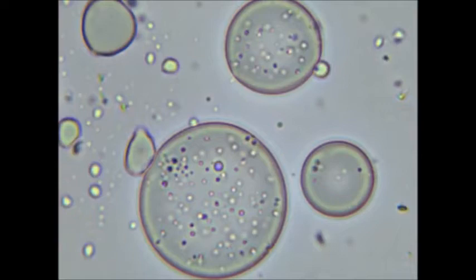I found this experiment which shows that fatty acid vesicles are less permeable to the external environment when a solution of an amino acid is added. In the original experiment, the researchers used the amino acid serine to produce fatty acid vesicles with multiple membranes, which are less permeable and have a greater ability to retain their contents.